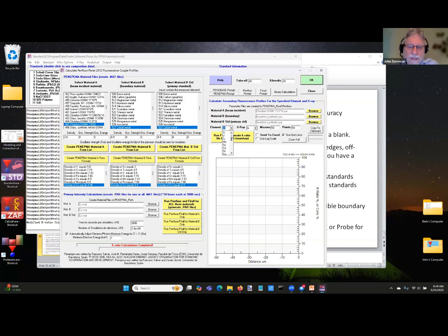fairly good correction. So if I do calcium, and I'll leave it at 20 kilovolts just for fun, and I run this here, and then there's an Excel output right here. You can actually output it to Excel right there, as you can see.